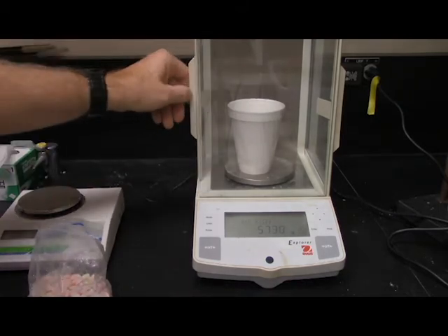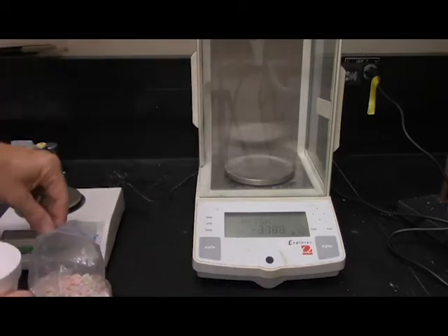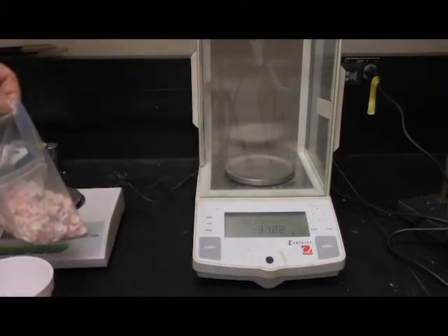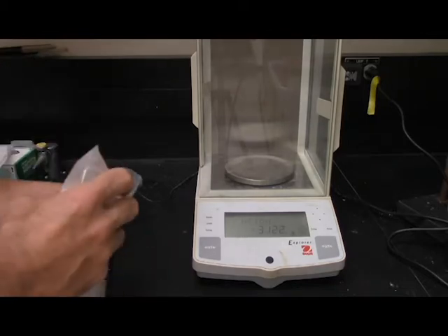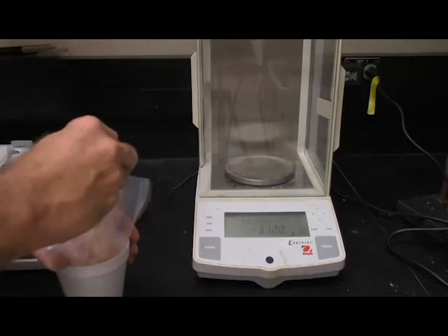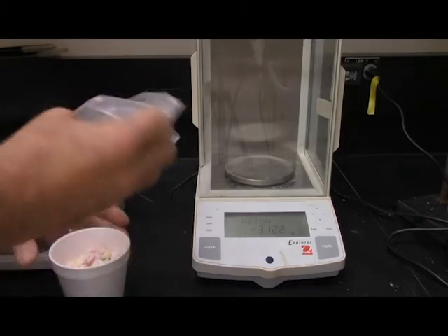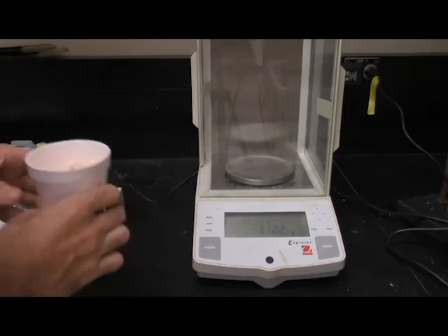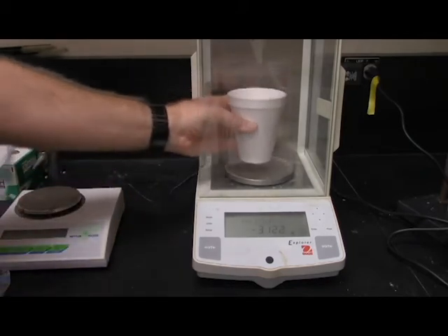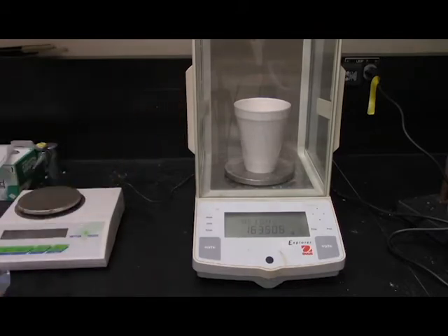And then of course comes the big one. Now we weigh all the Smarties. So all they go into our container. Oh, isn't that beautiful? Put that in there. And we let it weigh. And of course we write it down.